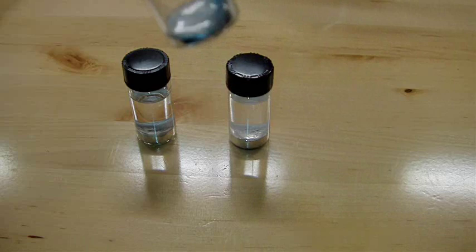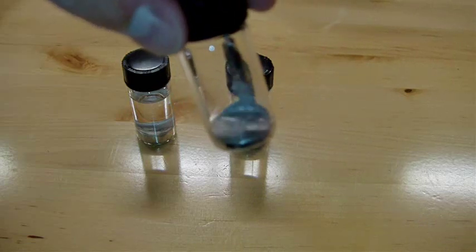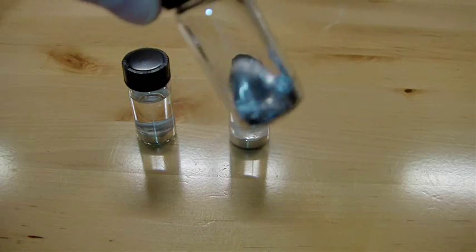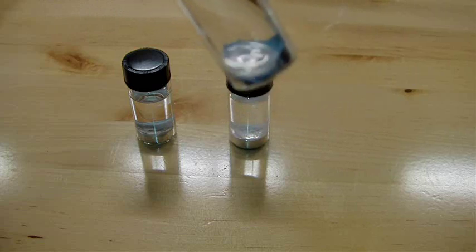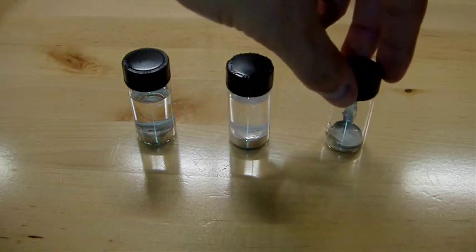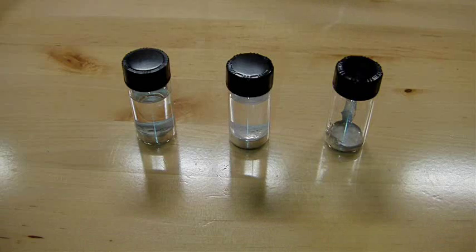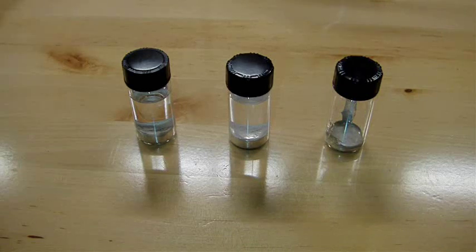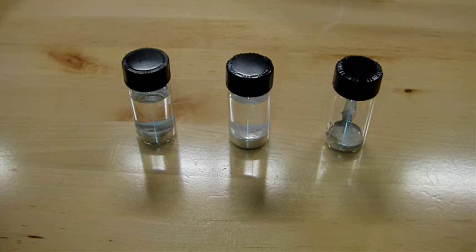And the last one that I have is the one that I had in air, and that actually is looking pretty good as well. That one, if you'll remember, I only had about a drop in there before. So actually, to make it a little bit more even, I took some out of the oil vial and put it into the air vial so at least you can see some of what's going on.